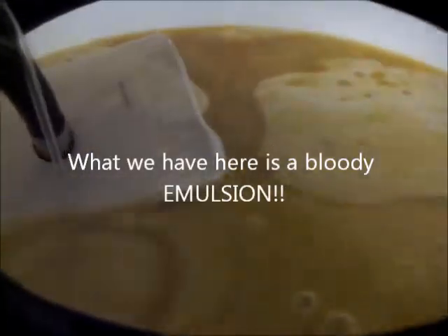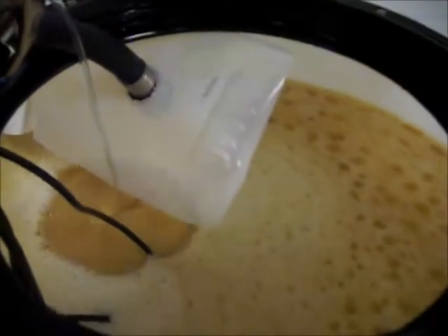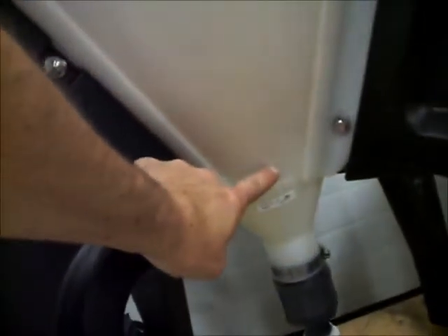So this is about the third or fourth wash and it's pretty milky on top. We started bubbling it to clear it up a bit. Here we are at roughly the fifth wash and you can see there's a bunch of foam on top still. We've got this layer of foamy stuff, then a layer of semi-clear, and then from there down is this yellow slimy stuff.